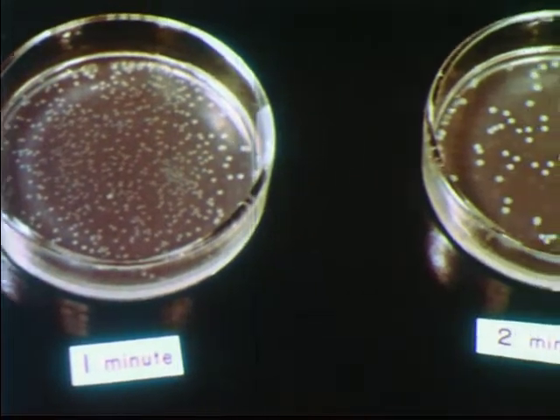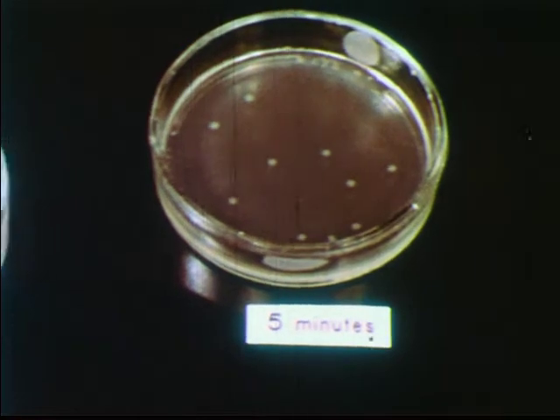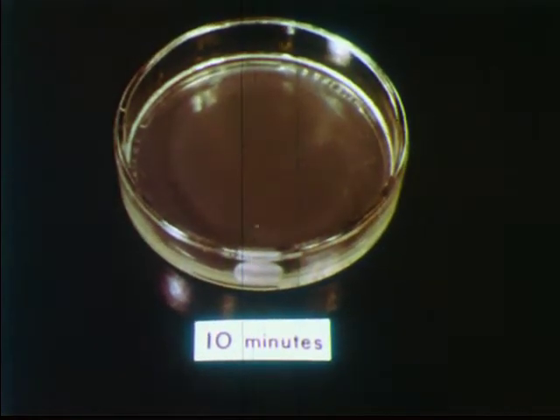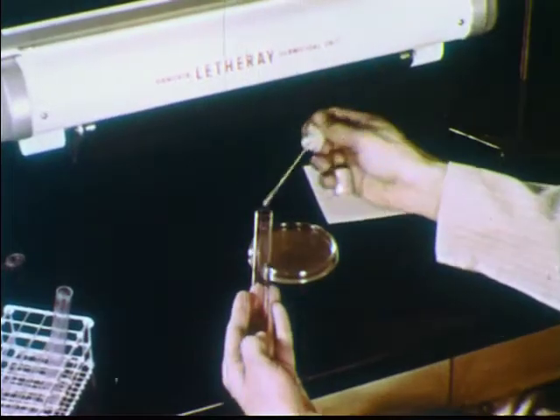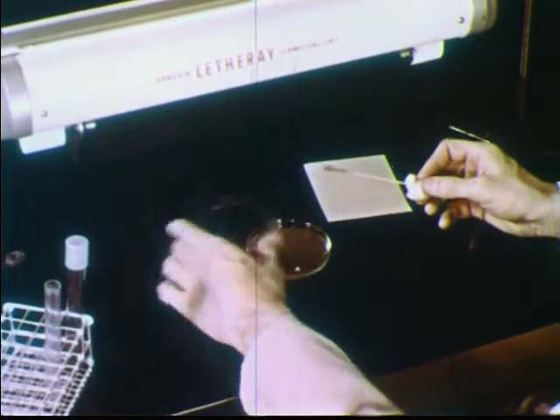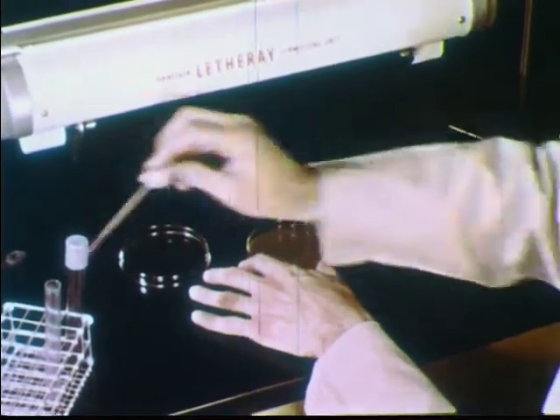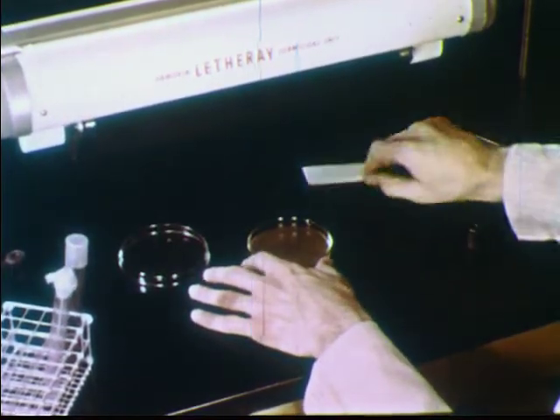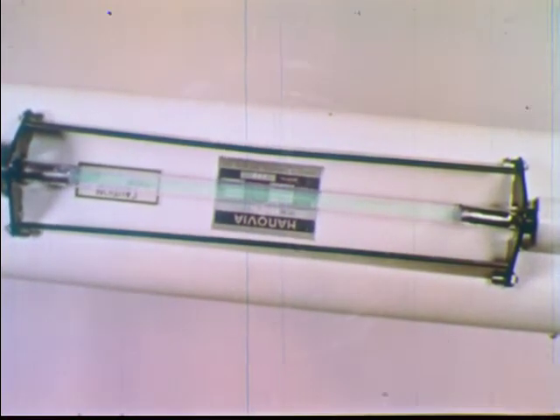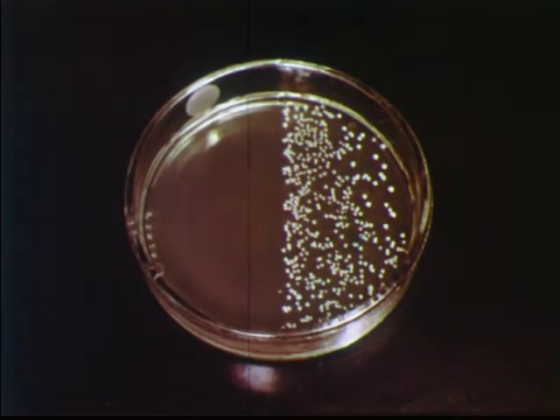Ultraviolet radiation from the sun or an artificial source also affects bacteria. Test organisms are spread over the surface of growth materials, the dish partially covered, and then exposed to ultraviolet radiation. After incubation, growth appears only where the bacteria were not exposed to the ultraviolet light.